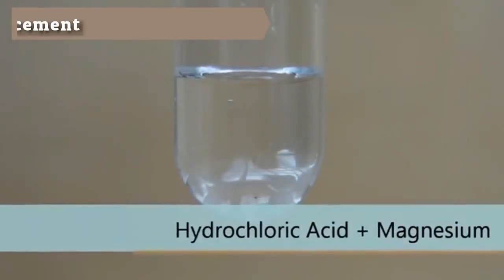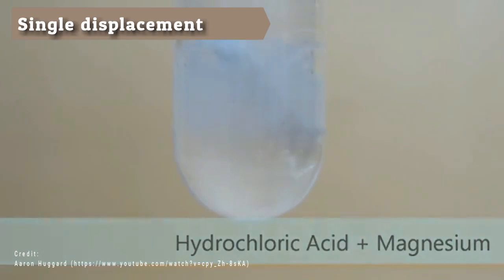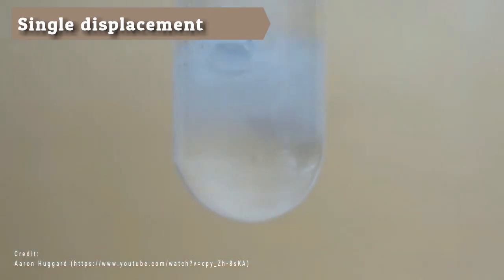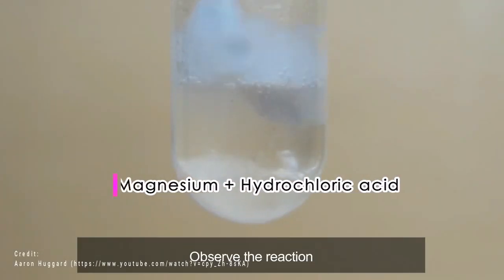Single displacement or substitution. Drop a piece of magnesium ribbon into a test tube containing 3 ml of 6 molarity HCl solution. Observe the reaction.